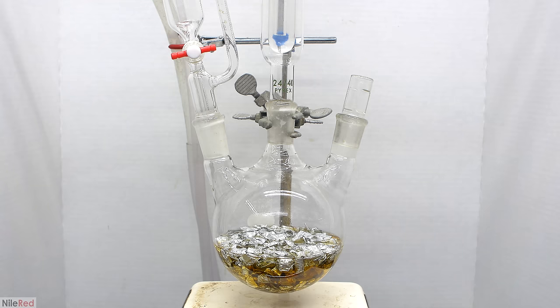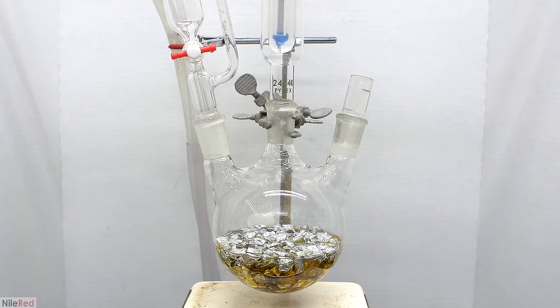Today, we're going to be making aluminum isopropoxide, which is a useful reagent in organic chemistry.